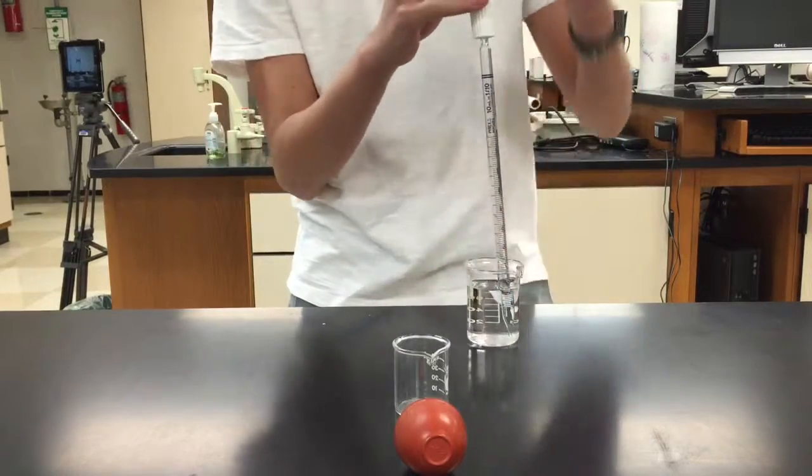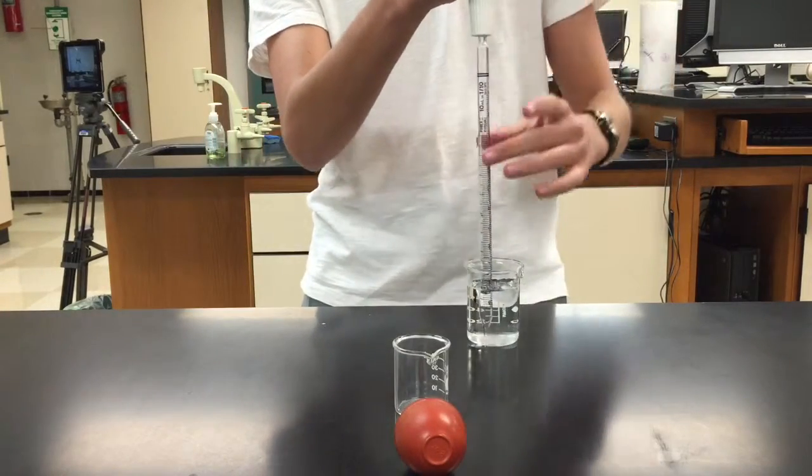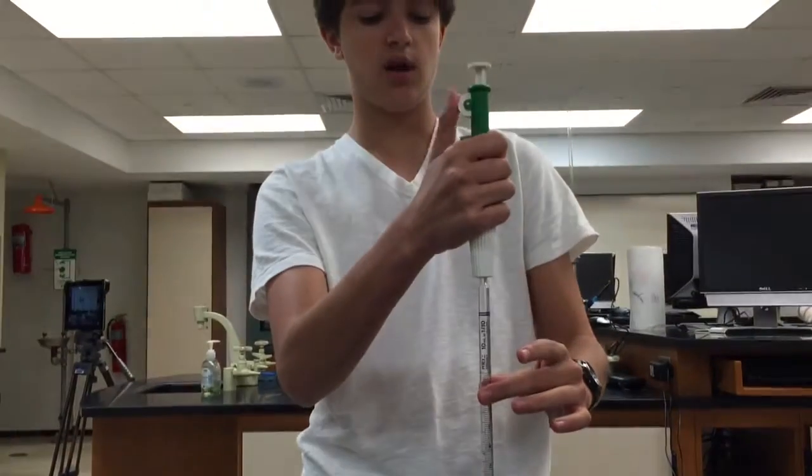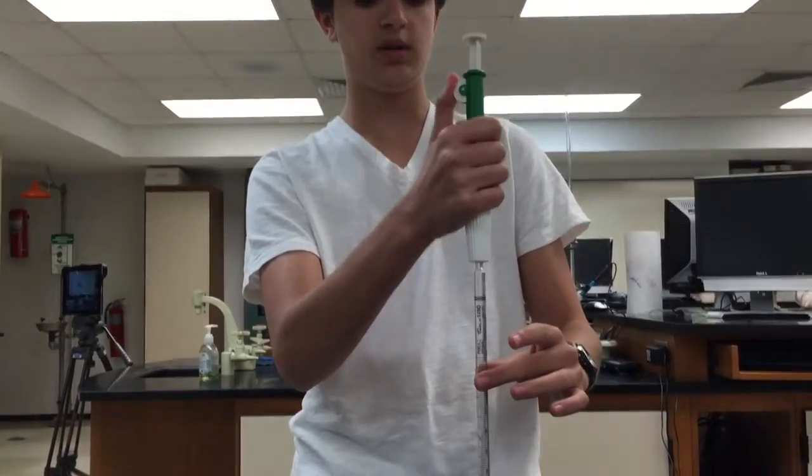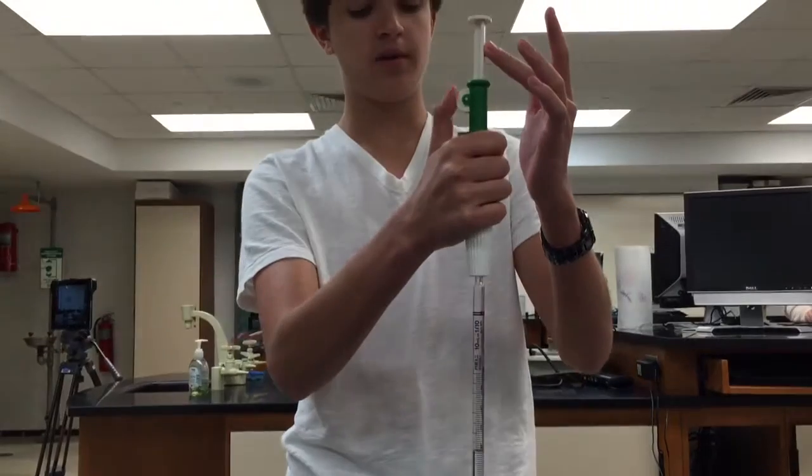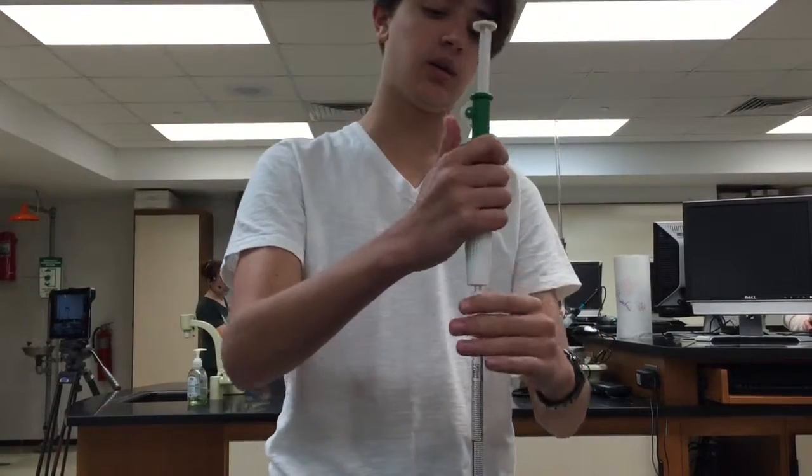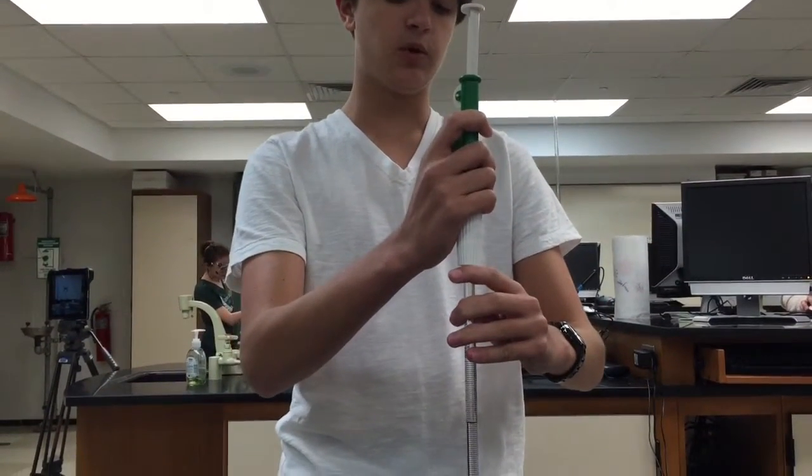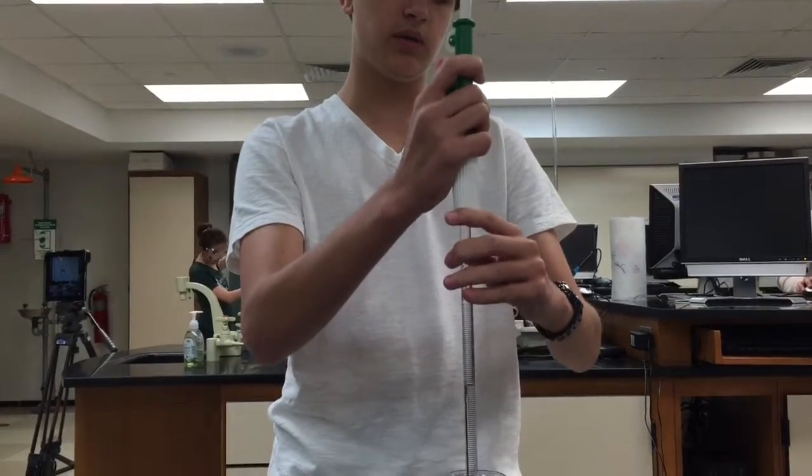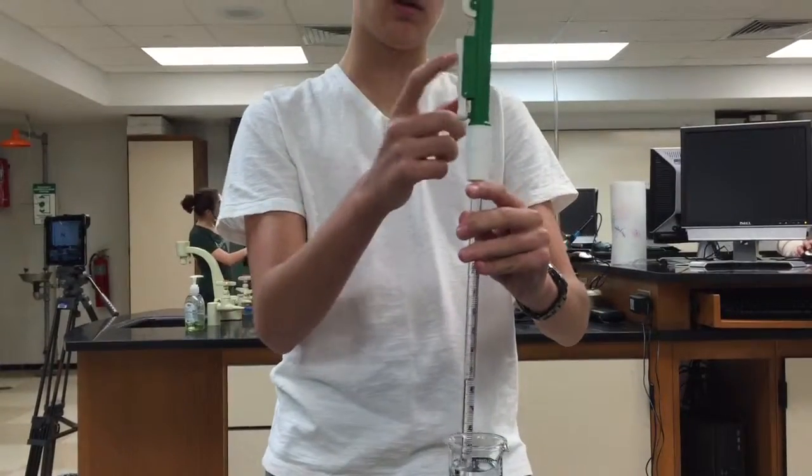Once you've done that, you're going to take the wheel and start to roll it downwards so that this starts to rise. See, I'm sucking the liquid up into it. So for this step, you only need a little bit of your liquid, so I'm going to let mine out. See with the button.